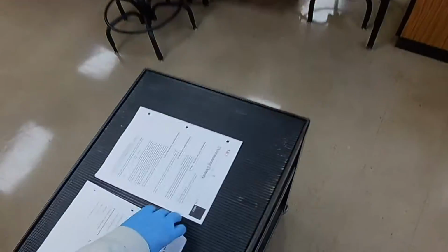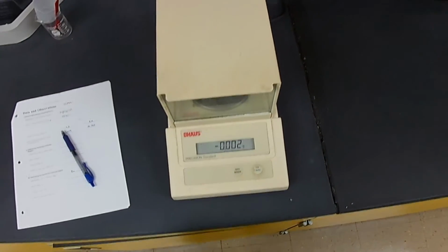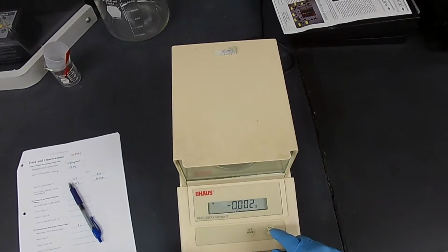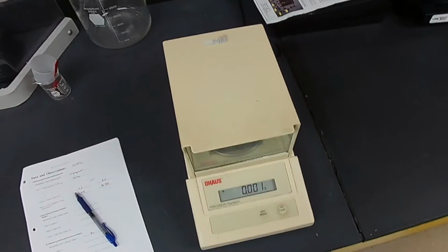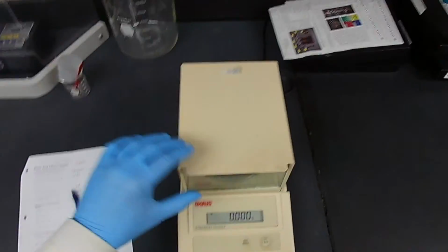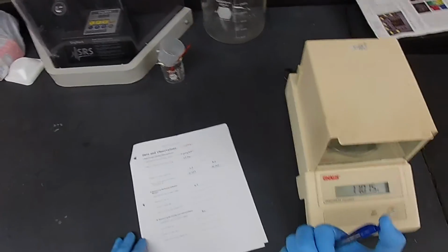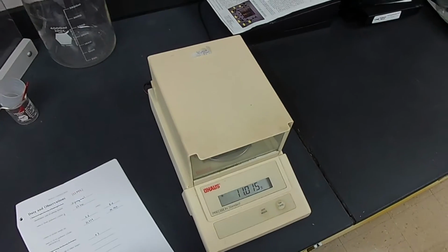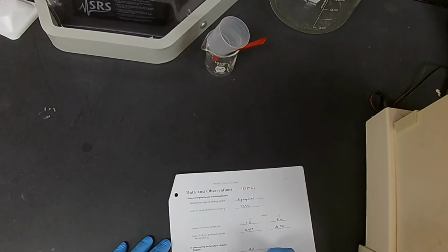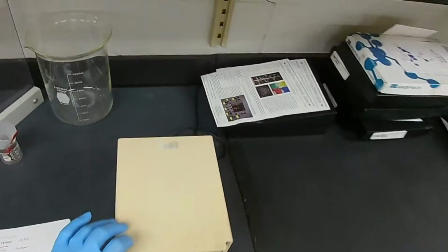We just bring our paper with us. Be sure we're set on 0. It doesn't want to settle down, does it? Give it a chance. There we go. Put the stopper on there, close the lid. Now we're going to get a stable number eventually. 11.016. 11.016 grams.